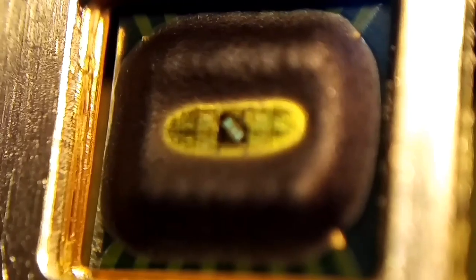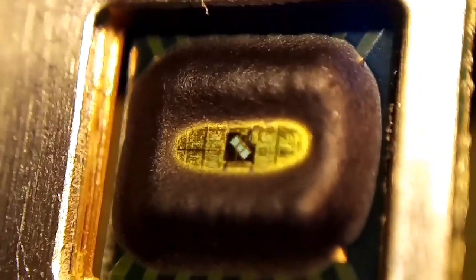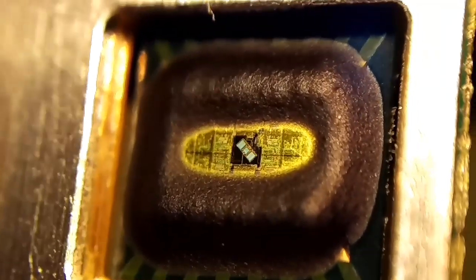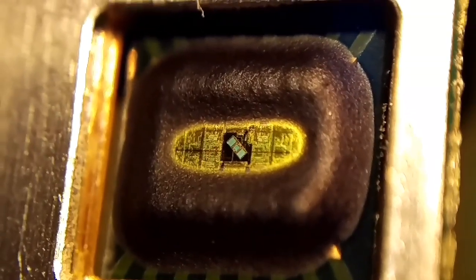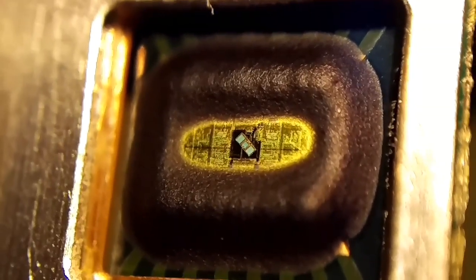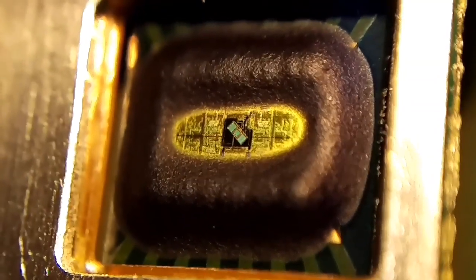This is actually how I took, a long time ago, the picture of a processor that's in the header on my YouTube channel. So yeah, it's an easy way to make a little microscope. Pardon my shaking hand, but I'm just holding this right now. The best setup is to use some sort of tripod, mini tripod or something along the lines. But yeah, there we go.